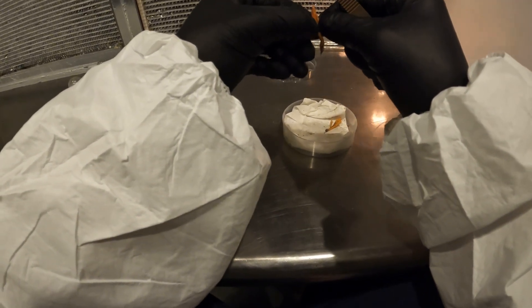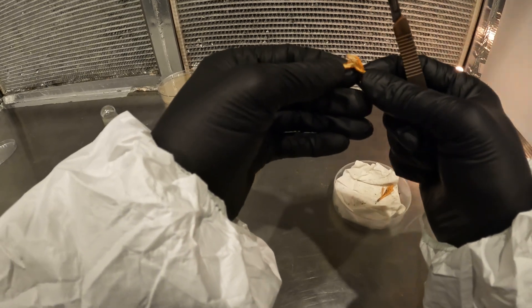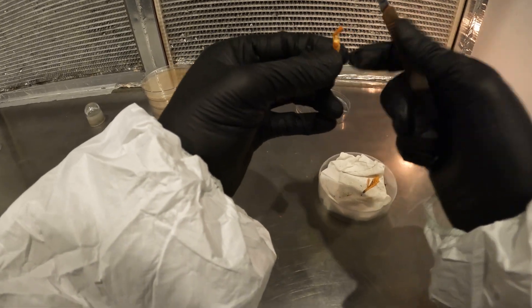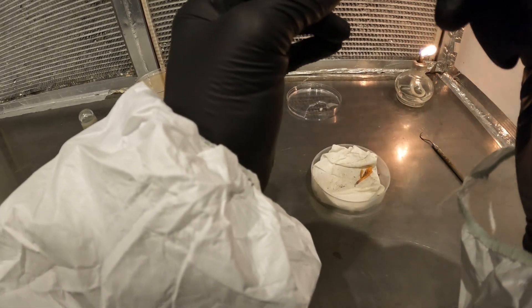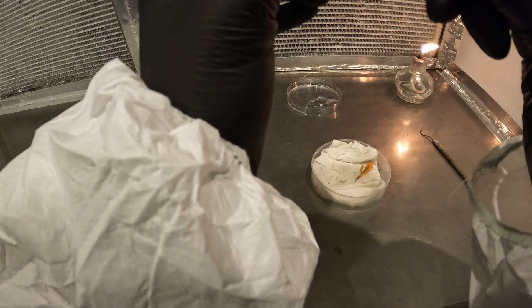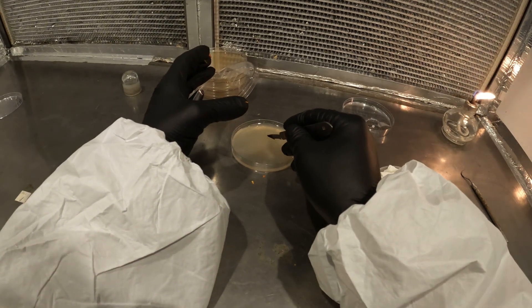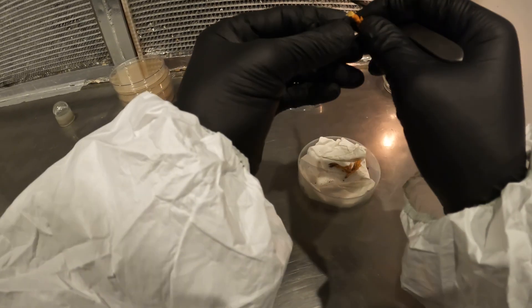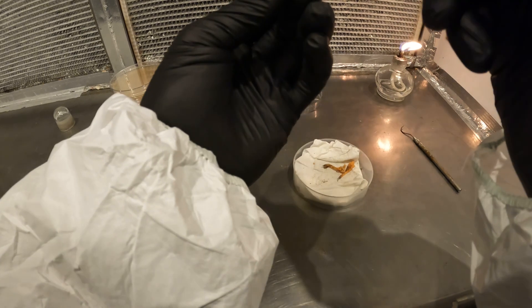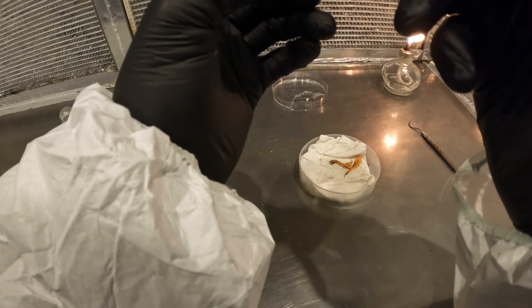So this is the last one right here — just pulling it open to get some tissue out of the middle. It's hard with these small cordyceps; that's why once they've dried up it's even more difficult. But I've got a way now where they just don't dry up as much and I can make them last for a few days. I'll put two or three tissue samples on here, because all you need is the initial germination, and then you transfer it to another plate to clean it up some more.